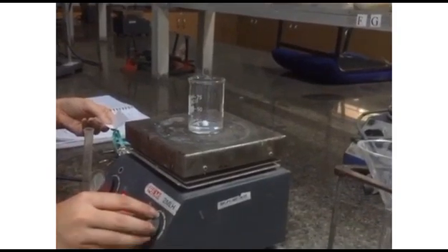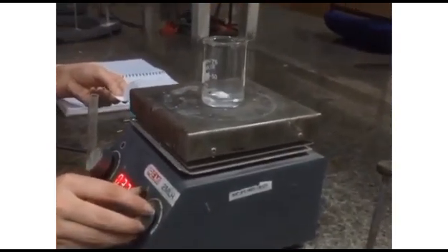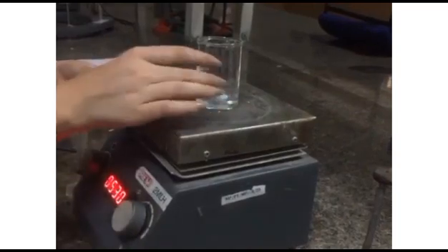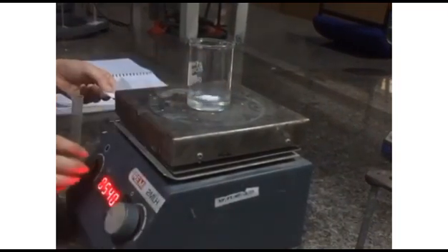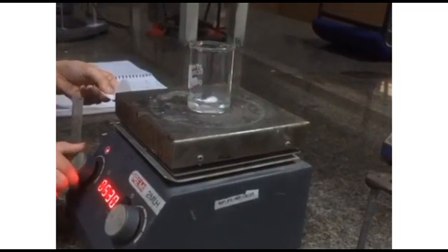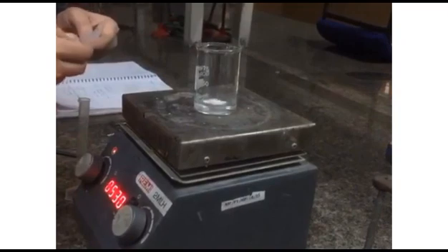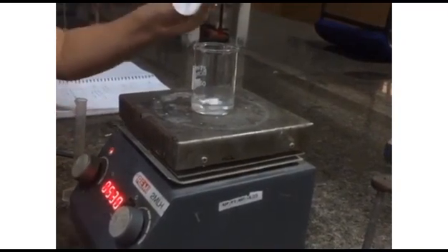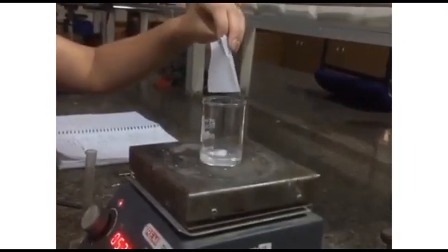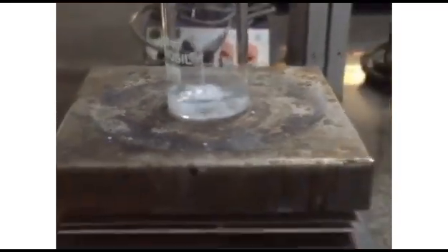To prepare the organic phase, we took 10 ml of ethanol into which we added our solid lipid, glyceryl monostearate. It was stirred over a magnetic stirrer until it was melted, kept at 500 to 550 rpm at 70 degrees Celsius.